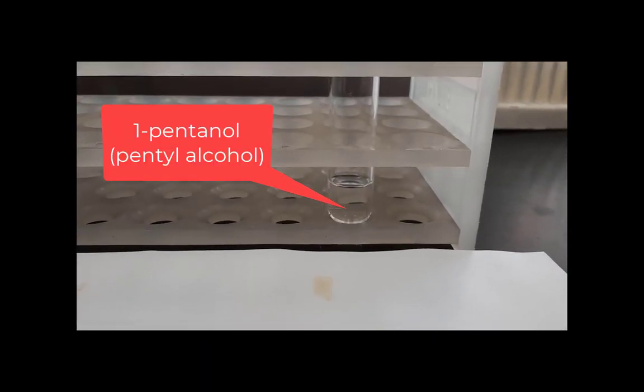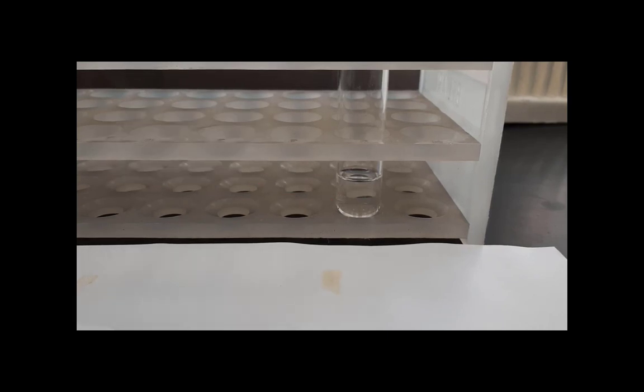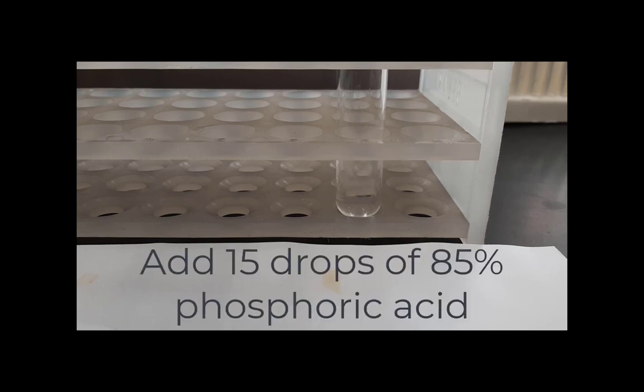I begin the experiment with 3 milliliters of 1-pentanol, also called pentyl alcohol. And to that, I'm going to add 2 milliliters of acetic acid. Next, I add 15 drops of phosphoric acid.